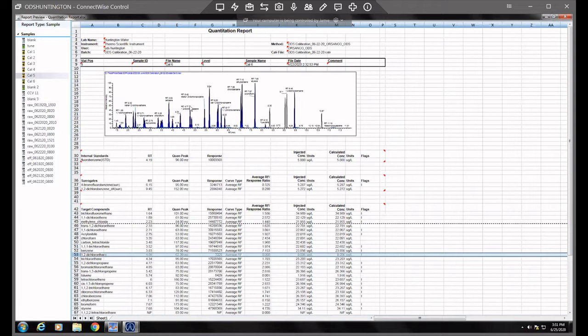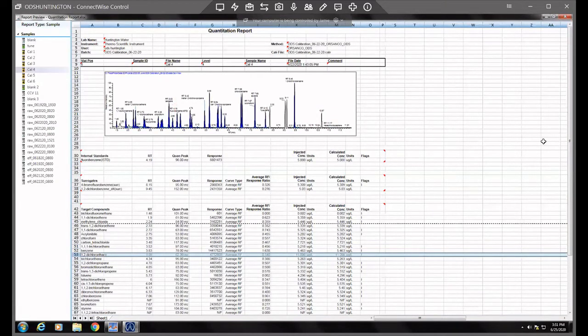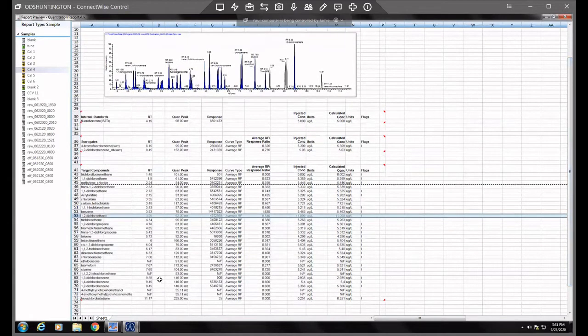But you can see how most of them are integrated, but there's a few here that are white. That means it looks like it wasn't found correctly. So let's do an easy one here on the end. Hexachlorobutadiene, sorry if my pronunciation is incorrect. They're not the easiest words to say. But we know that that's our last peak.